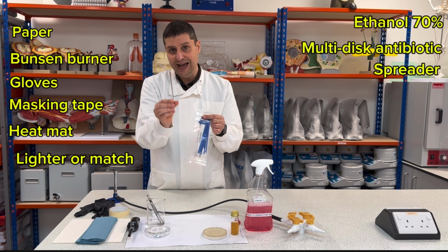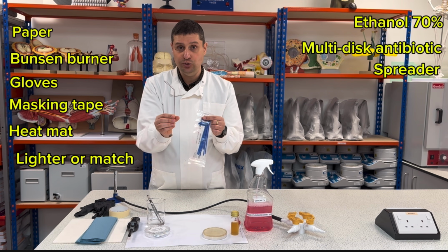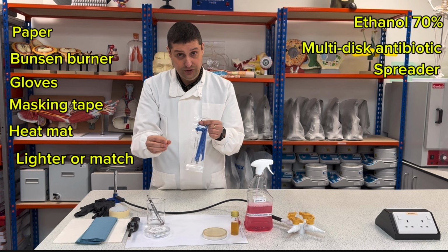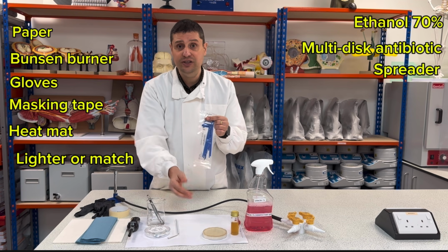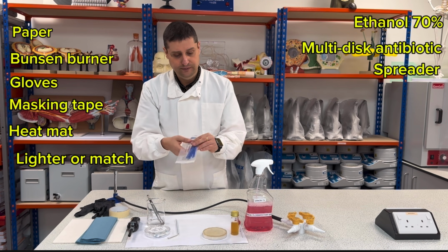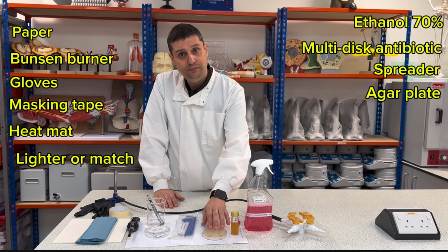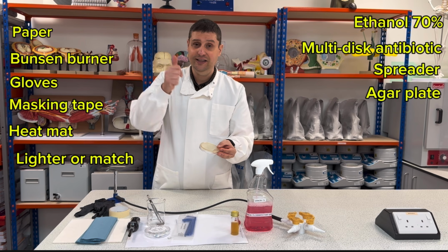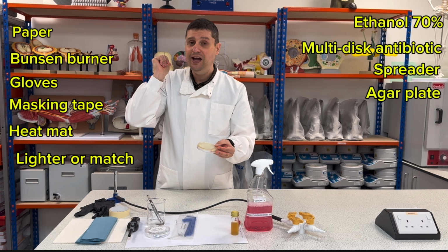We can use a glass spreader, which we also disinfect every single time I use it, or I can use just a disposable one that after I use, I just dispose. I have my agar plate that was done in advance. You can check in the previous video how to do it.